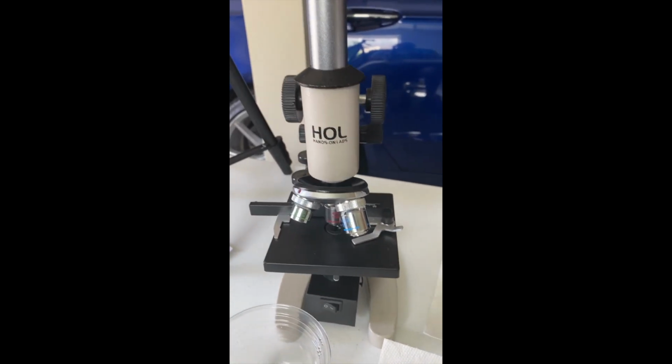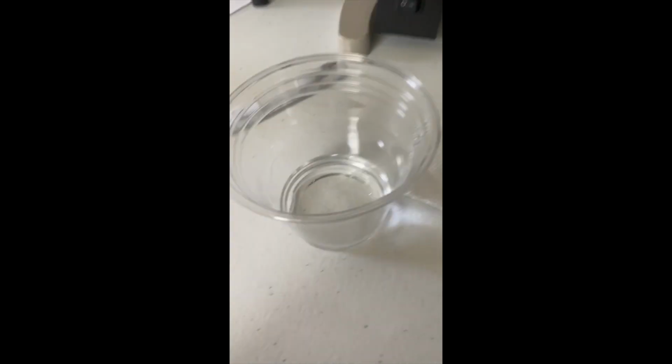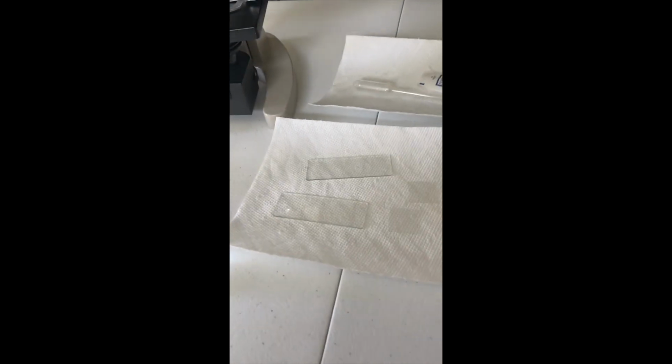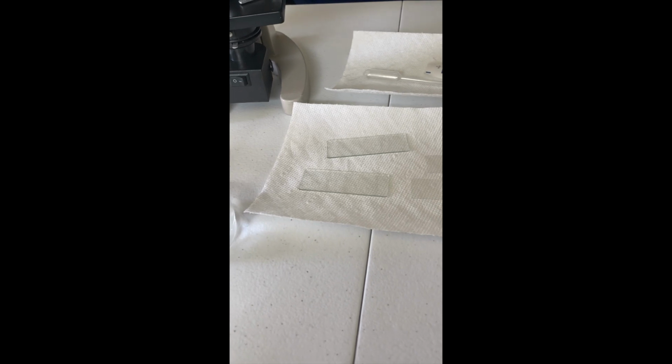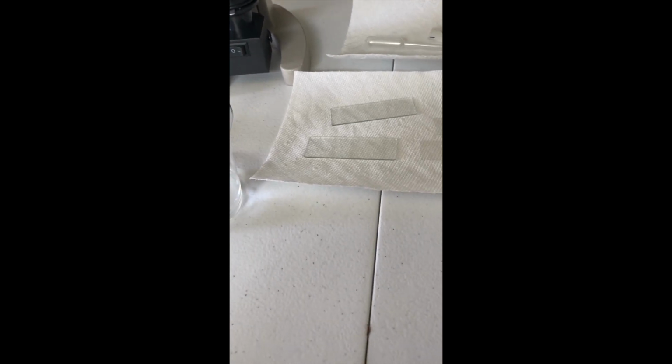I, of course, have my microscope, and then in here, I have a bit of distilled water that came from this wash bottle. So what I'm going to do, and I'll do my best to show this to you, is take a cotton swab, rub it on the inside of my cheek. I will then spread that sample on the slide, put 1 drop of distilled water using this pipette onto the slide, and then cover it with the slide cover and then view it under the microscope.